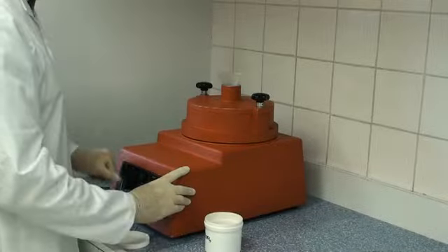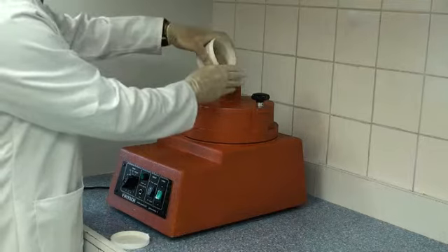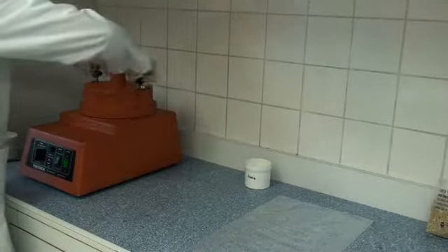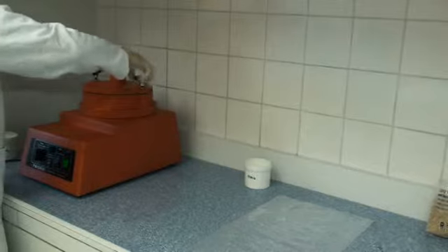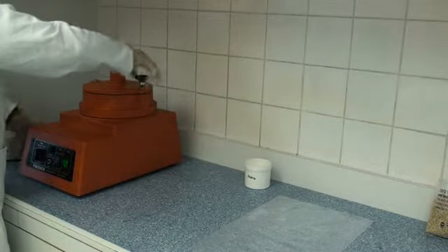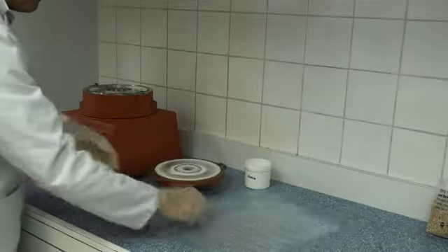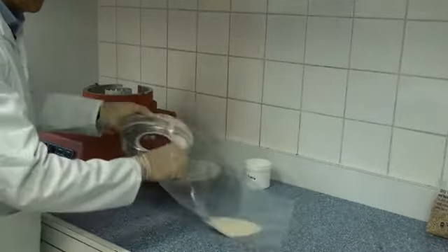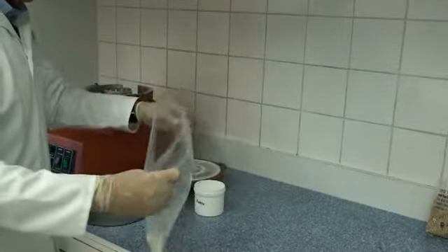Grain or malt samples are milled to pass a 0.5 mm screen using a Fritsch or Retsch centrifugal mill. After milling, the mill lid is removed and the sample is transferred from the collection tray to a plastic bag. This is then transferred to a plastic storage container for convenience.